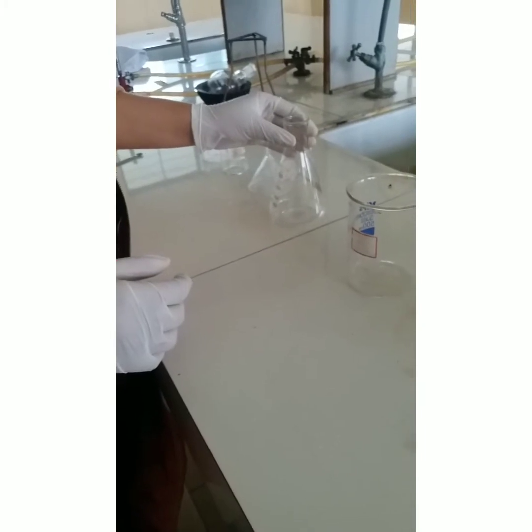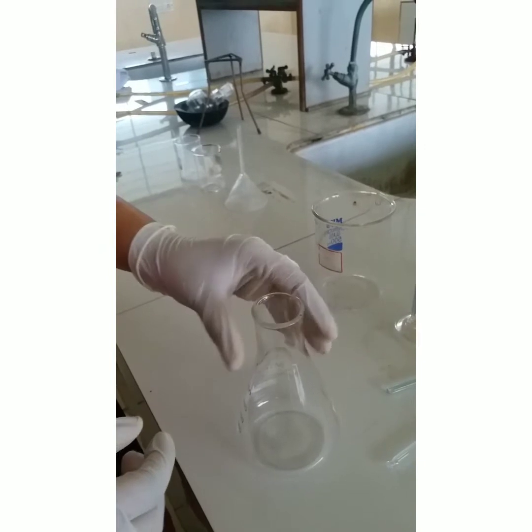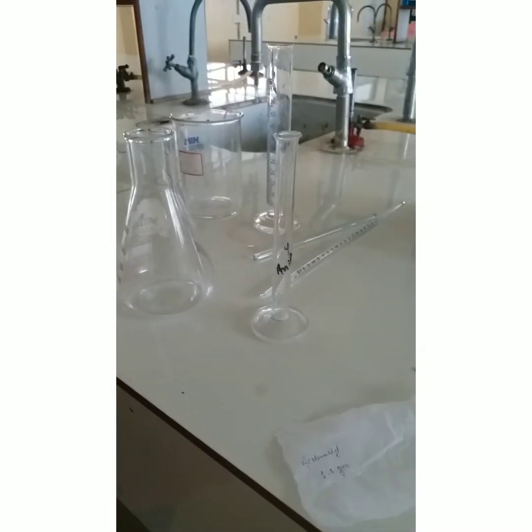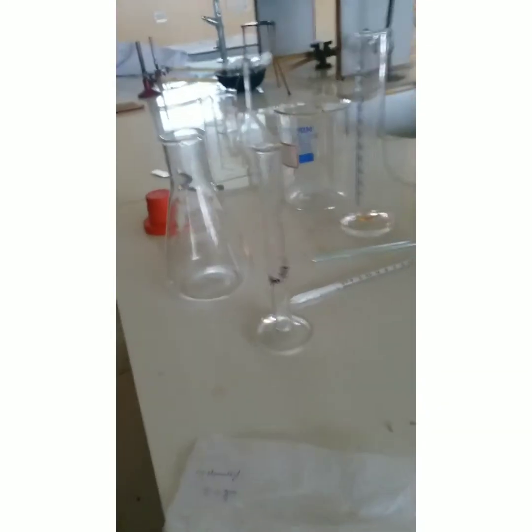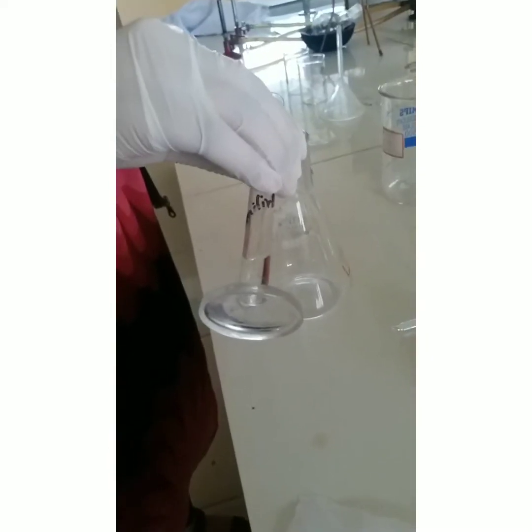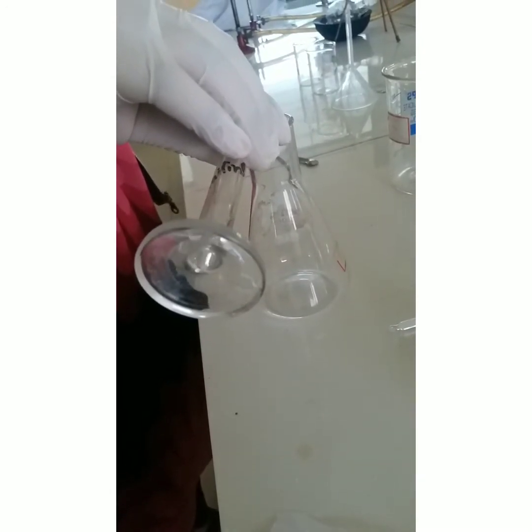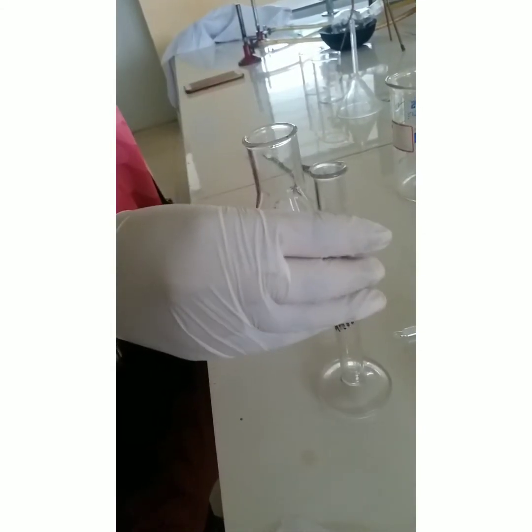In another conical flask, dissolve 2.7 ml of bromine, then add 12.5 ml of acetic acid into the conical flask.